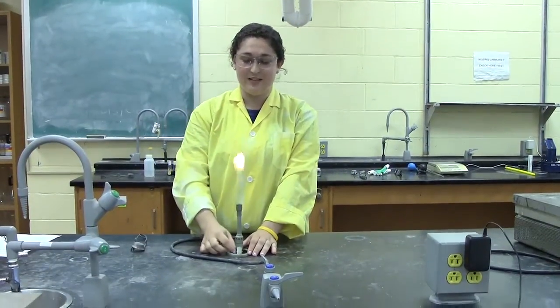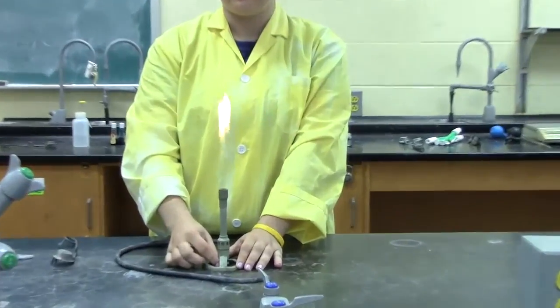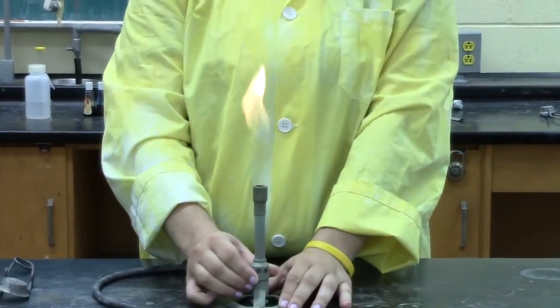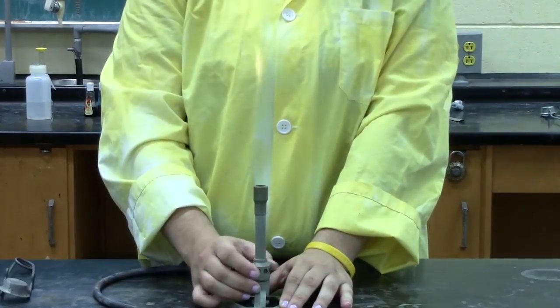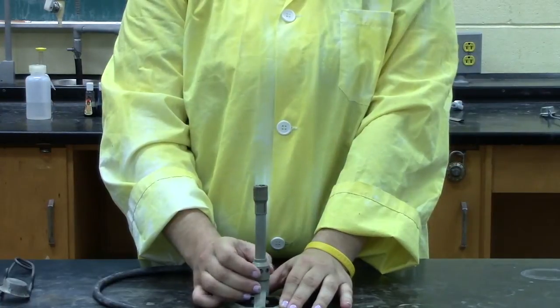When you light it, you get a nice high flame here which you can adjust through the gas valve. You can then adjust the color with the air valve. You want to have a nice blue flame which will cause the most heat.